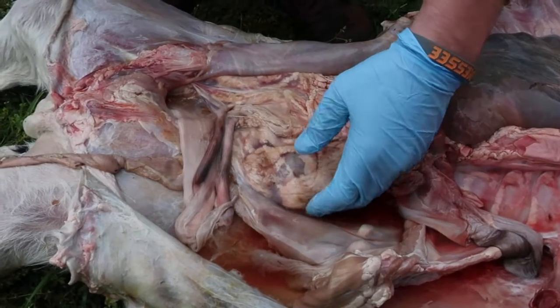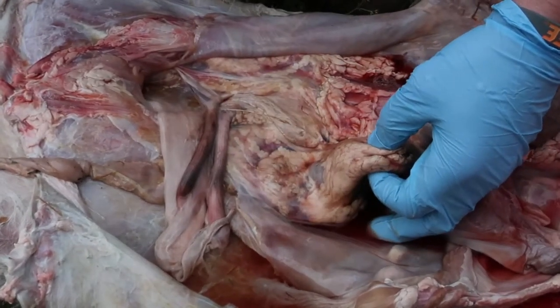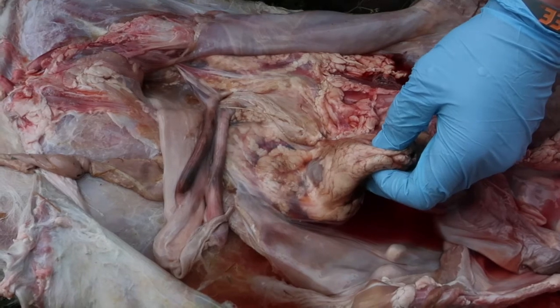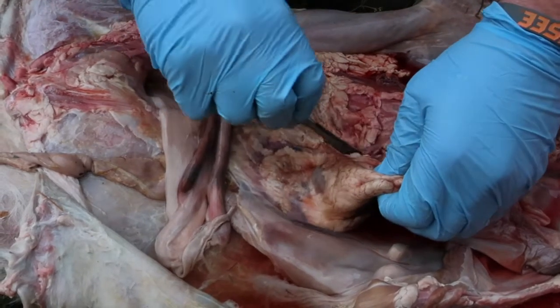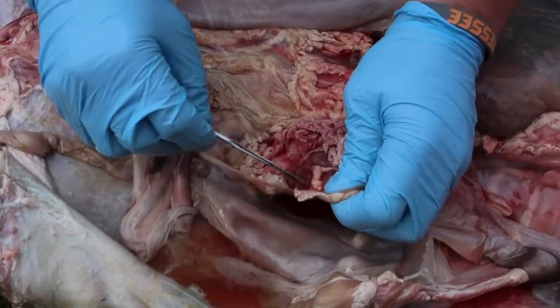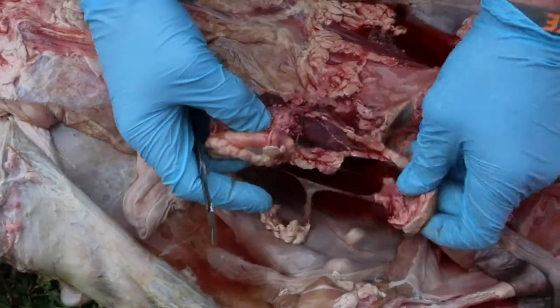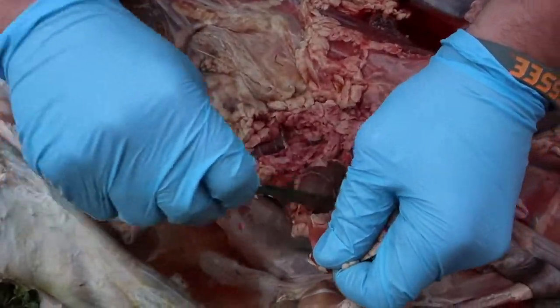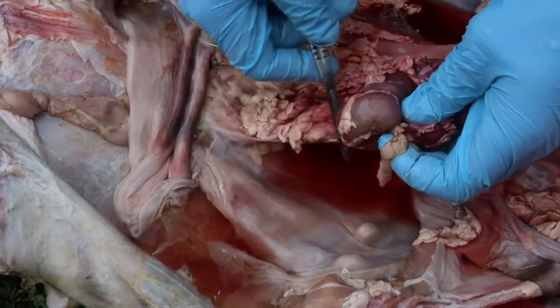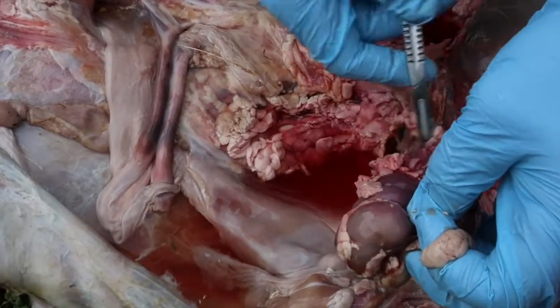Okay, so what I'm going to show you now, I'm going to dissect the kidney out for you so we can take a look at that. The kidney is really important for filtering the blood and removing any toxins that might be in the blood, and also helps to maintain salt and water balance in the animal. The kidneys of the cow are pretty interesting because they have what look like lobe-like structures on them, and you can see them here. In other animals, the kidneys will look a little more smooth, but you can definitely tell in the cow that it has these more lobe-like structures on it. And you can see there's a lot of fat. All this white stuff around the kidney is actually fat that's accumulated here.